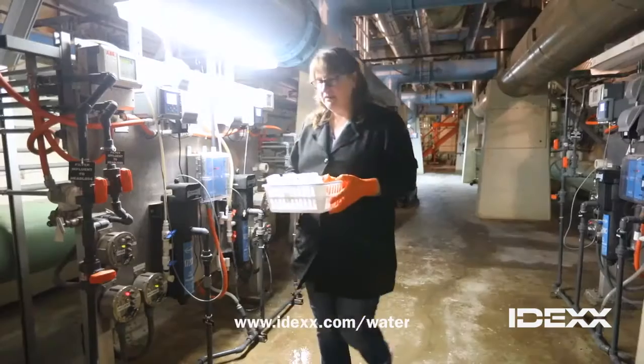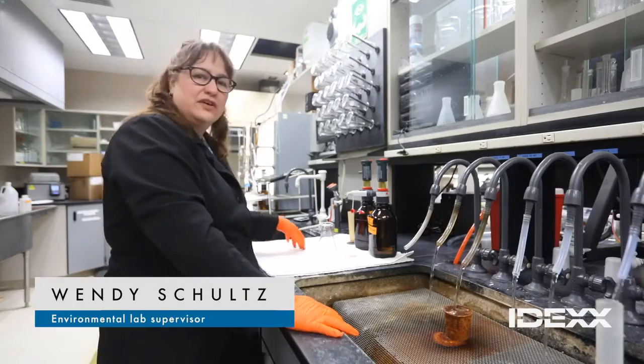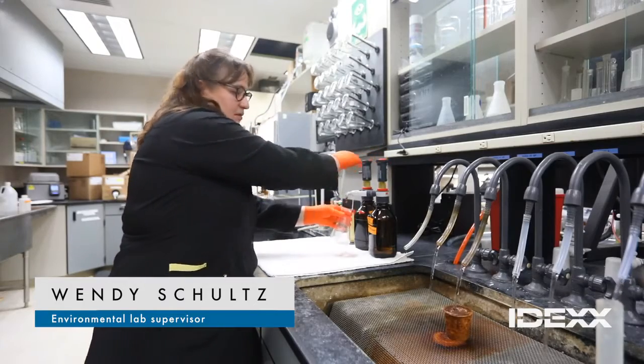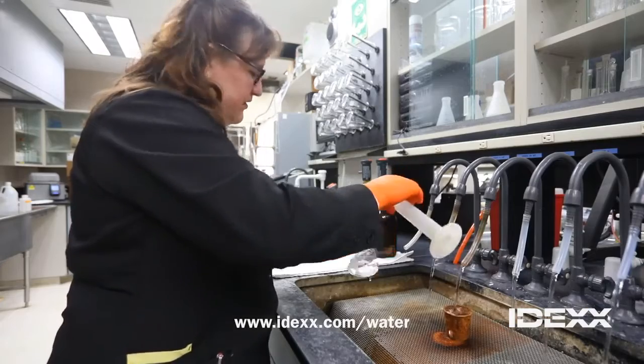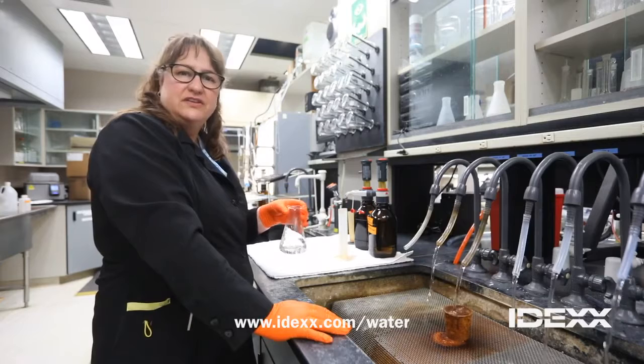I'm Wendy Schultz. I'm the lab supervisor for the City of Ann Arbor. We test our water for chloramines, chlorine residuals, and we do that using a titration method. This is water that's coming from our reservoir, which is the beginning of our distribution point.